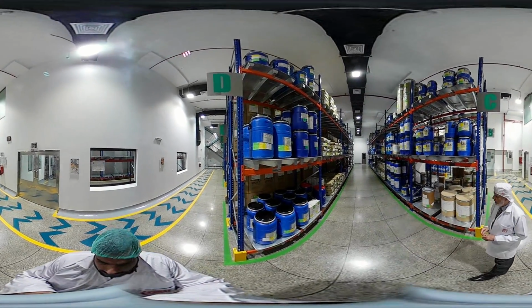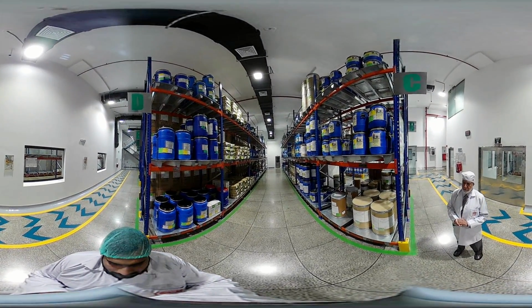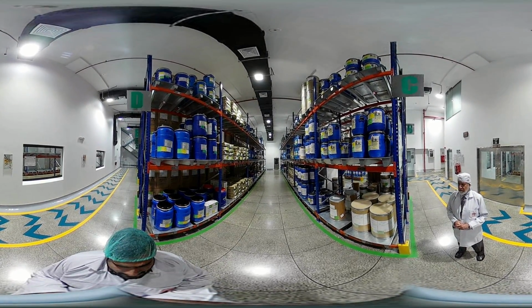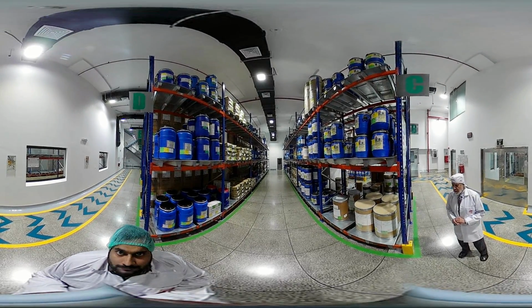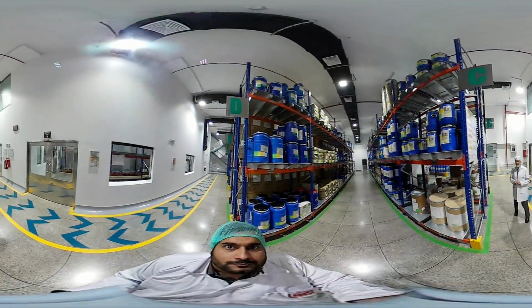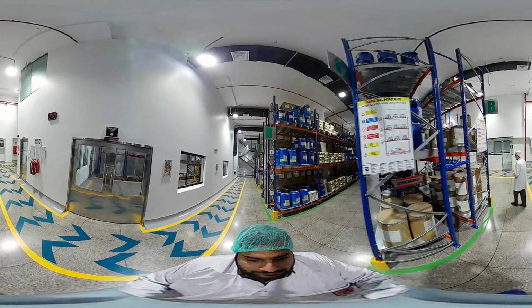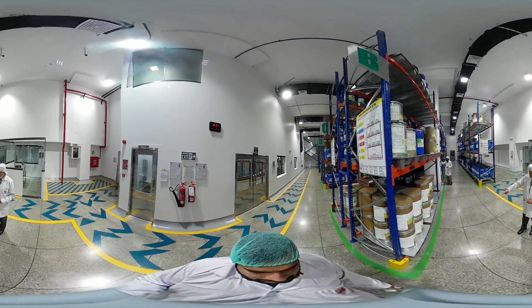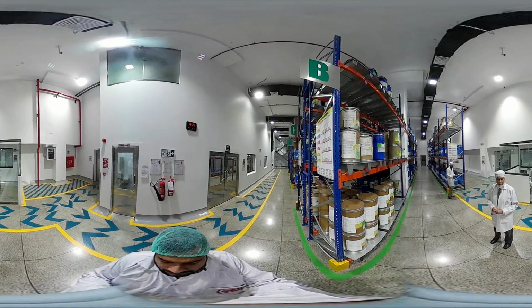At the same time, as far as storage requirements and good storage practices are concerned, we maintain conditions as per our specifications, from a humidity point of view and from a temperature point of view. We also keep logging as a data history 24/7 for the temperatures. We keep data loggers in different locations like this one, and it shows even the last 6 months, up to 1 year.